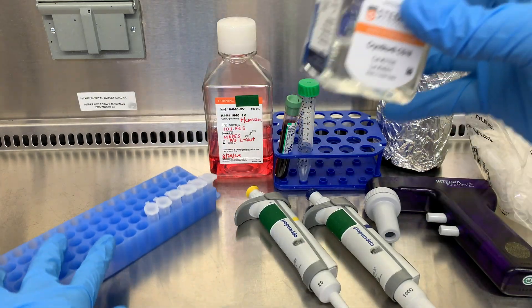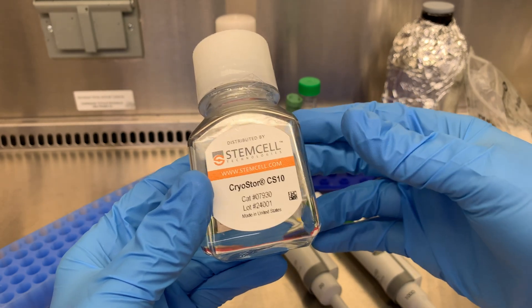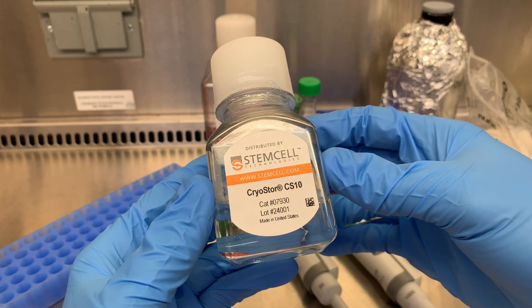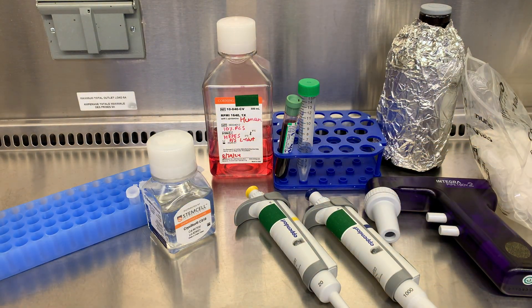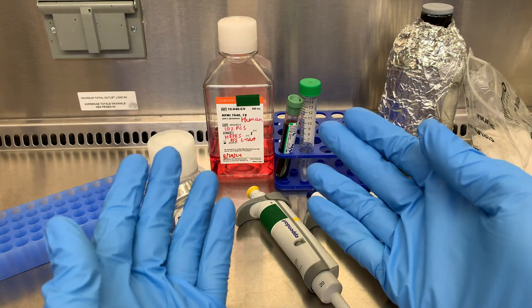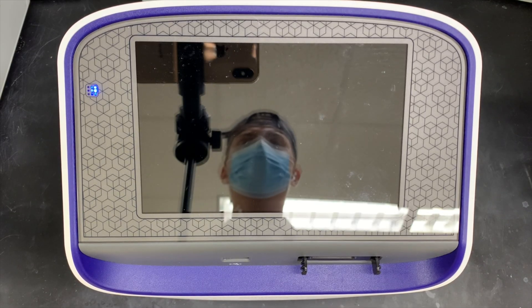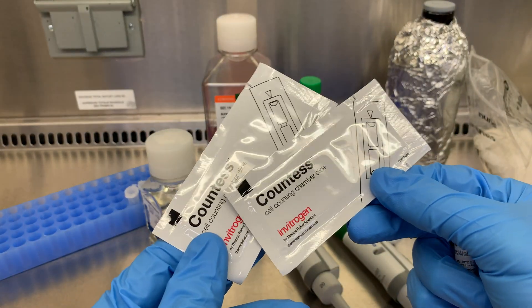You need something like cryostore to freeze cells in the minus 80. If you freeze them in regular media or PBS, you're just going to kill your cells. The cryostore is formulated to prevent the cells from rupturing when they're frozen — the dimethyl sulfoxide reduces the freezing point, allowing for slower cooling, and it prevents ice crystals, all of which are important to reduce cell damage. Sorry if I'm being too detailed in this video, but you don't want to be caught off guard when your PI asks why we do what we do. I'll be doing this in a clean biosafety cabinet with a vacuum aspirator, and for PPE I'll be wearing a lab coat, nitrile gloves, and if my boss asks, I'll also be wearing my safety glasses. I'll also be using a cell counter — I hope you also have one of these — which will need these little cell counter slides, as well as trypan blue.